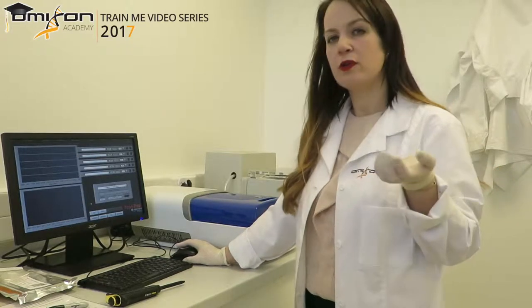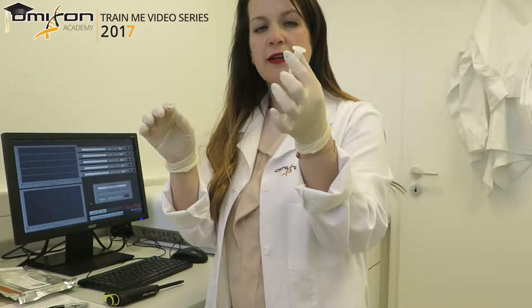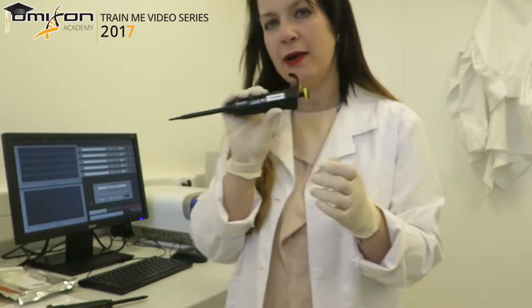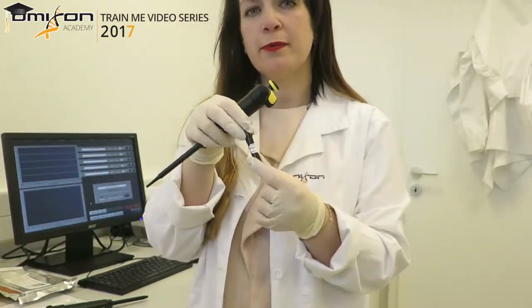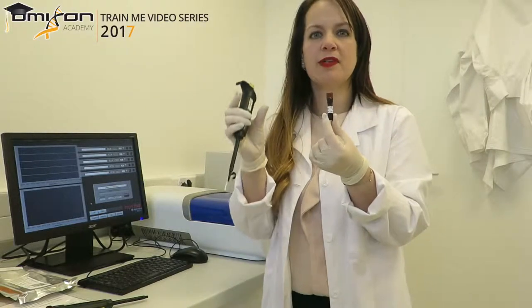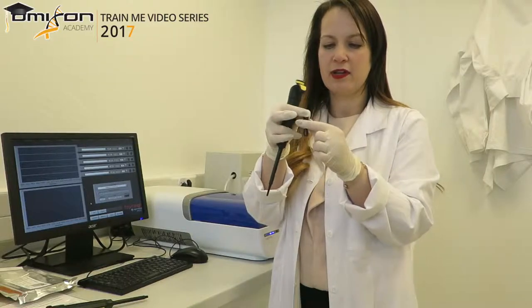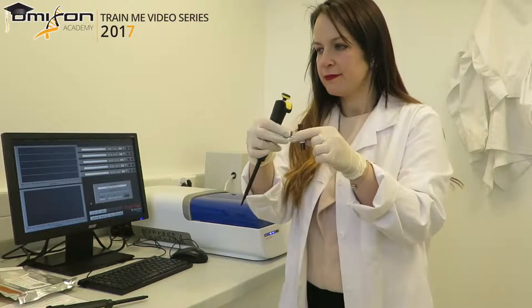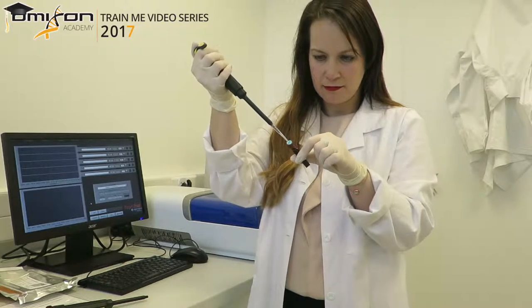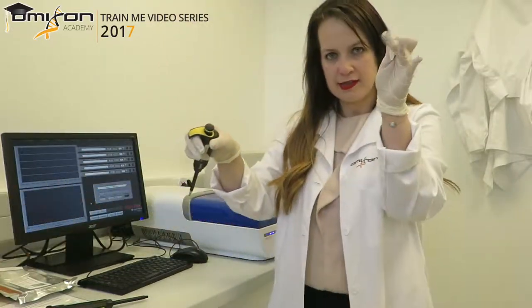For the library, we have our ligated and AMPure bead cleaned-up library — 30 microliters. We add 10 microliters of marker. In the PippinPrep reagent kit there are two fluorescently labeled markers: one is a 50 base pair fragment and the other is a 150 base pair fragment, both fluorescently labeled. We take 10 microliters of the mixture of those two markers and put it directly into our library.